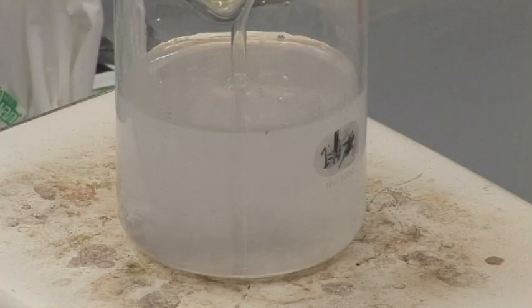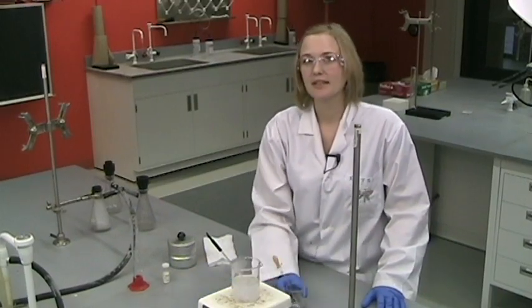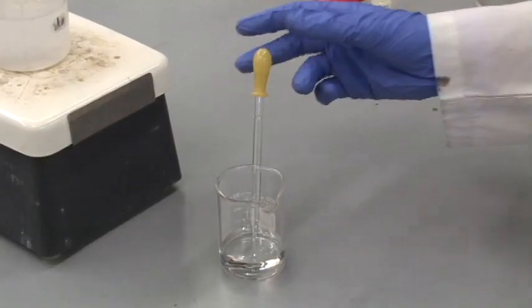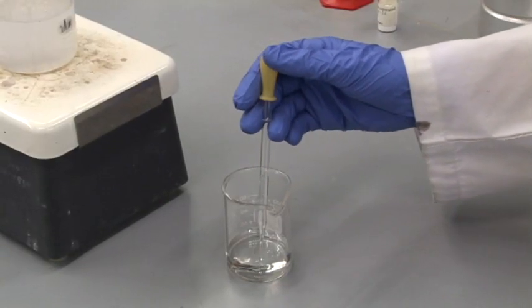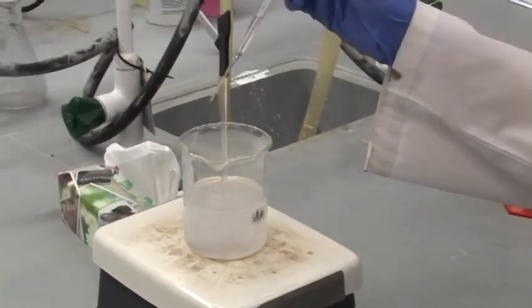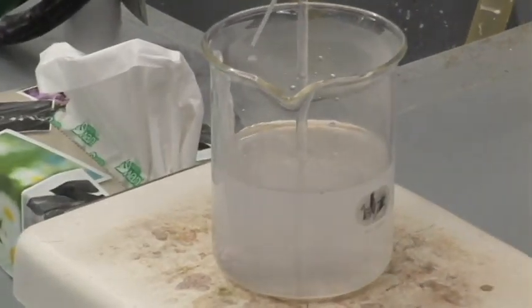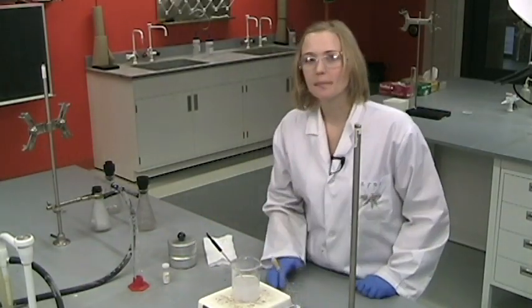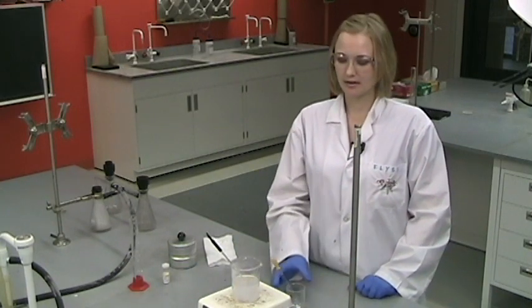When the supernatant liquid is clear or almost clear, you just need to check that you've added enough silver nitrate to precipitate out all of the chloride. You'll use a little bit more silver nitrate to make sure that you have precipitated out all of the chloride ions. So you will take a dropper and watch as you're adding a few drops to the supernatant liquid to see if any more precipitate forms where you're dropping it. If you don't see any, you added enough silver nitrate to begin with and you're ready to stop heating it.